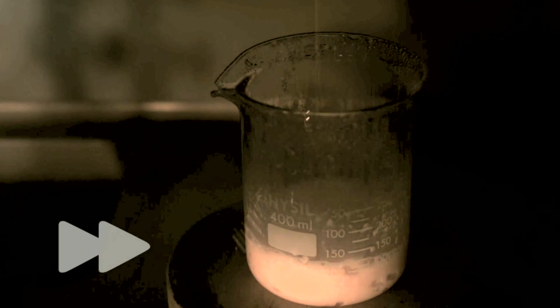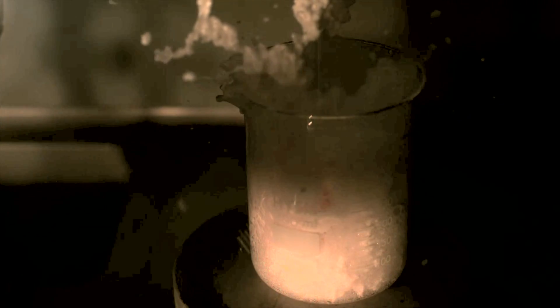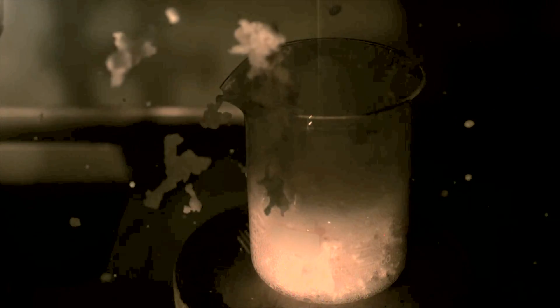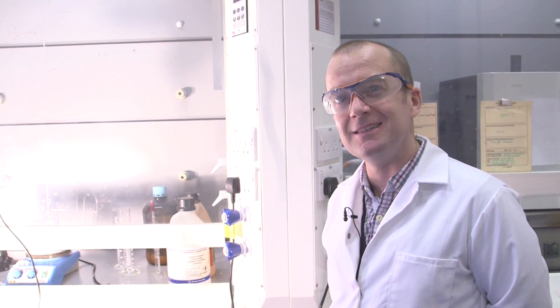Well, we're a bit disappointed, actually, because it's not as good as yesterday's. Yesterday's we coated the inside of the fume hood with Bakelite. And we don't really know why it's different yet, so we'll have to think about that one. We do have footage from yesterday's, so maybe we'll look at the footage again and see. But you filmed that, didn't you?